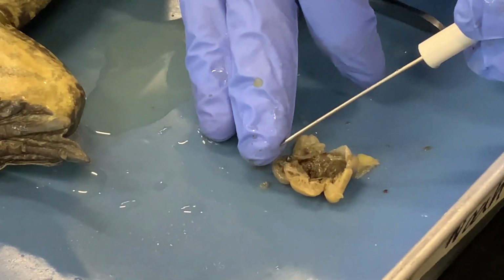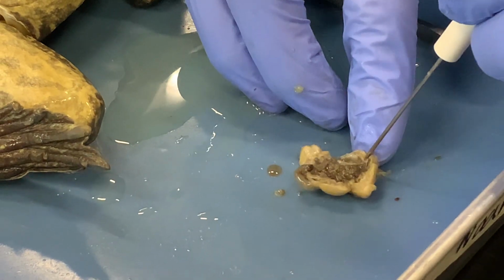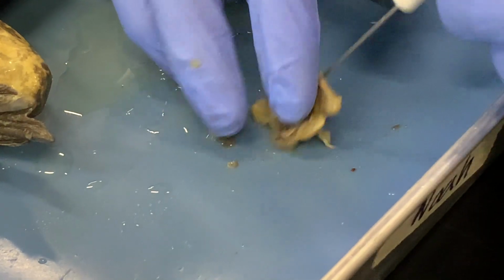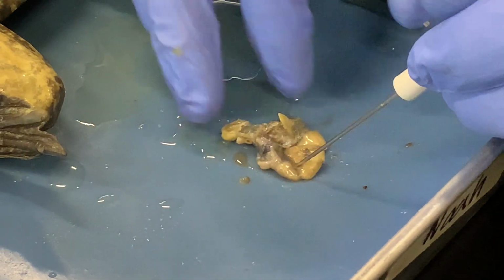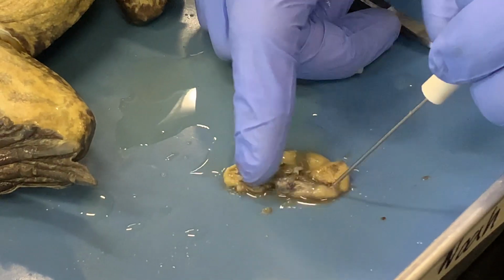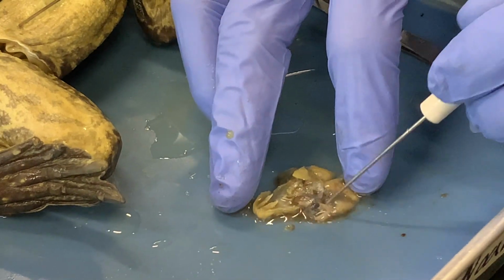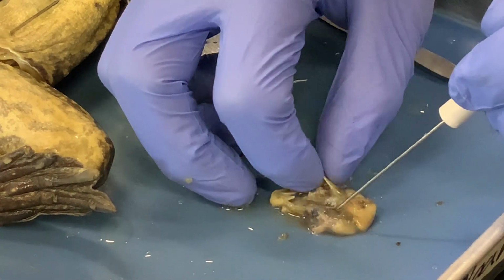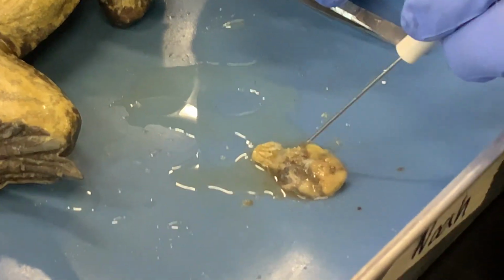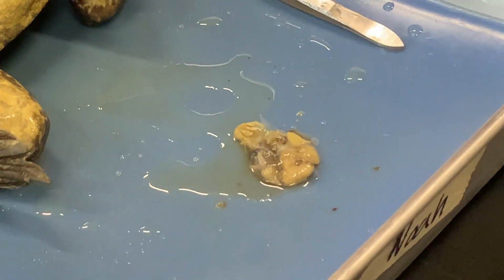But this empty bag on this side is one atrium, and there's a second atrium here. And if we rotate the frog over, you can see the two sides of the ventricle that we've cut in half here, and the pockets that form the atria here and here. So we will compare that to the hearts from a few other animals when we get to those.